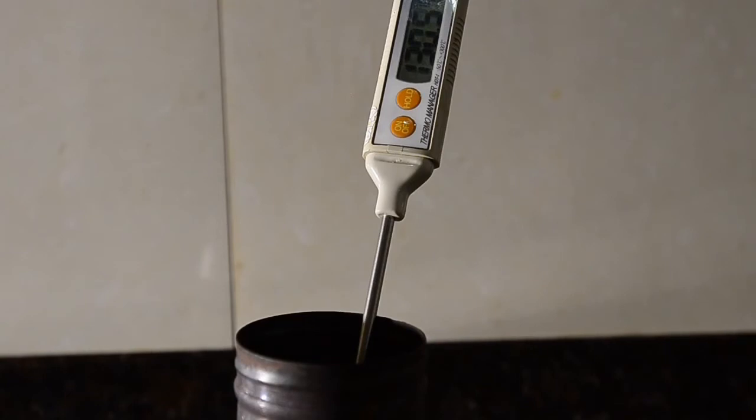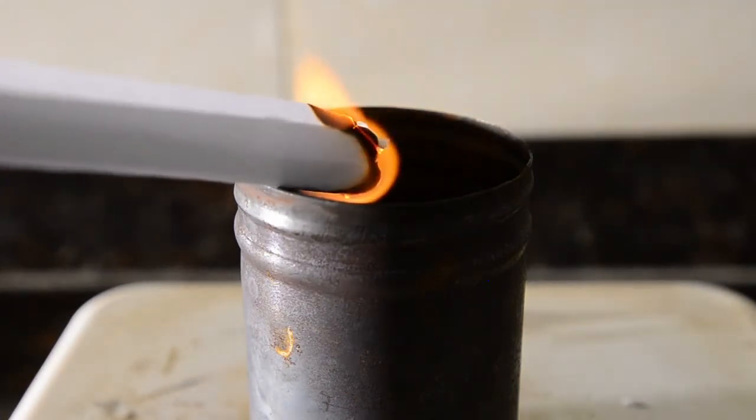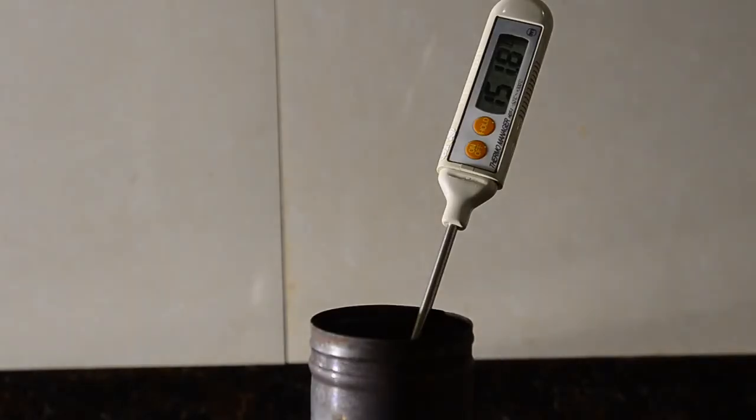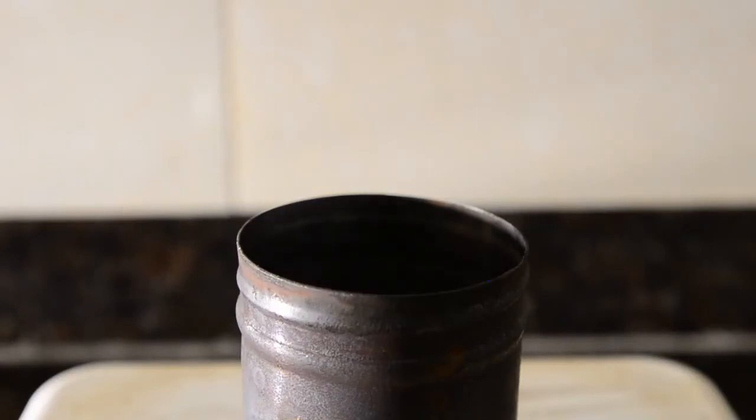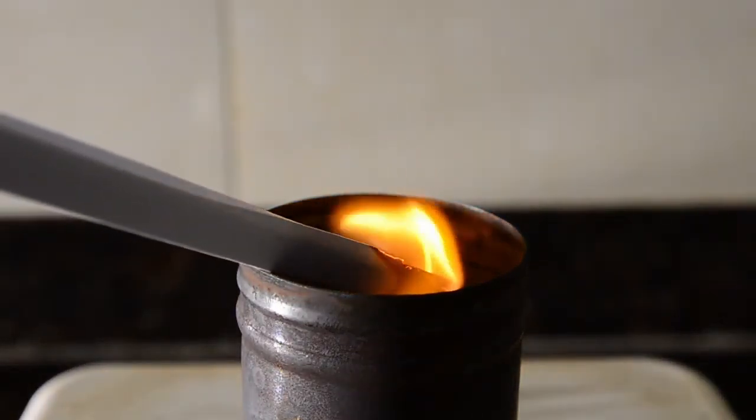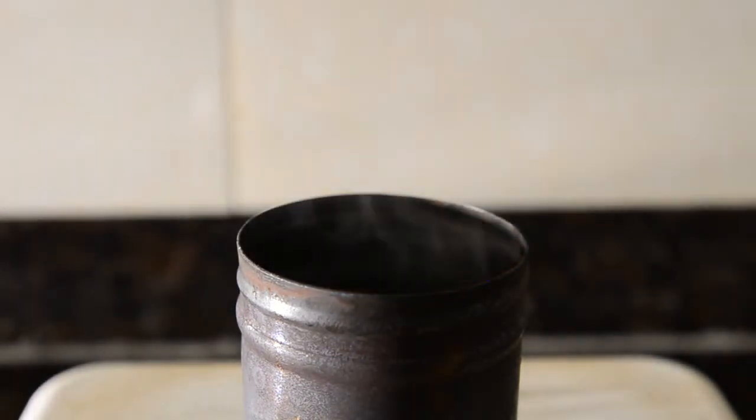130 degrees C. Let's see if the vapor will flash. That's a no. Okay, 152 degrees C. No again. We're looking for the point that there's enough vapor to catch fire. We'll see a flash and hear it when it goes.